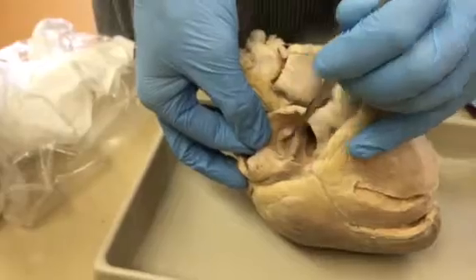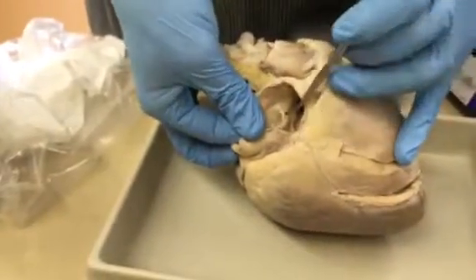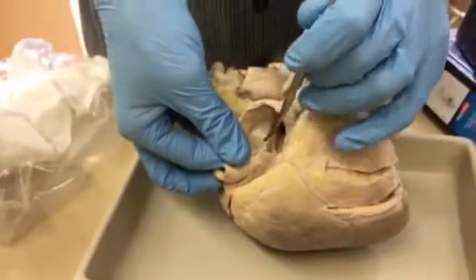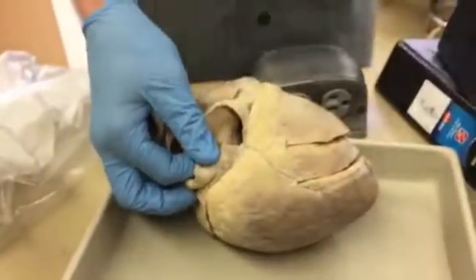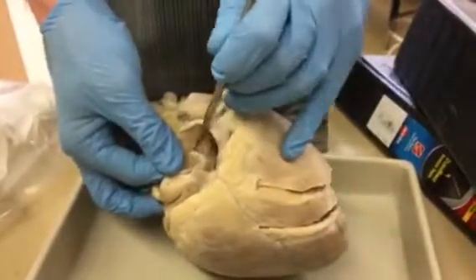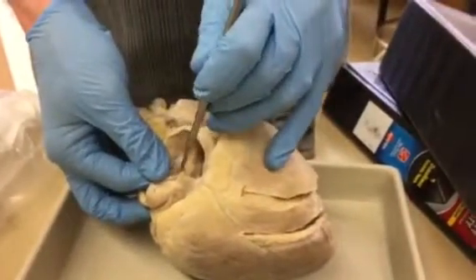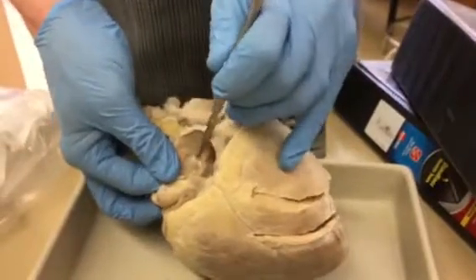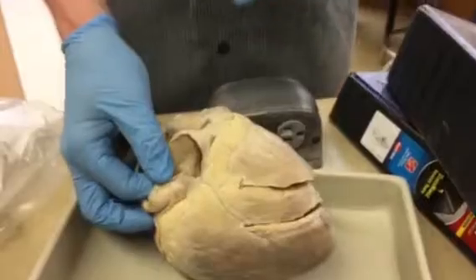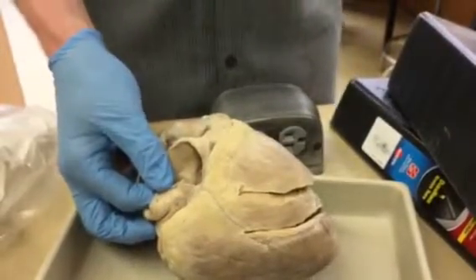You see that? And you can tell how thin it is because you can almost see my finger going through it. So that used to be the foramen ovale, the opening for fetal circulation. And then it starts to close up right before birth and just after birth. And this little membrane forms, and now it's called the fossa ovalis. Okay. So we can only pin the fossa ovalis because the foramen is the opening that's no longer there.